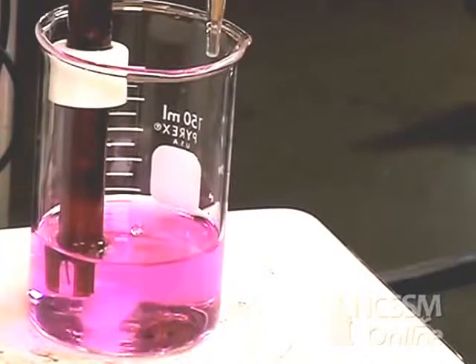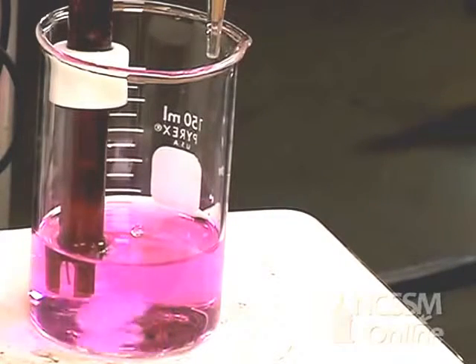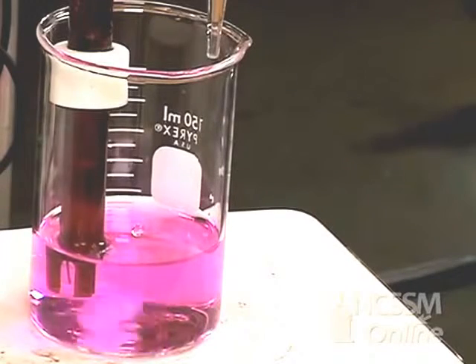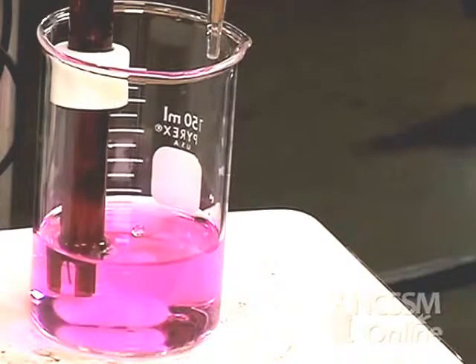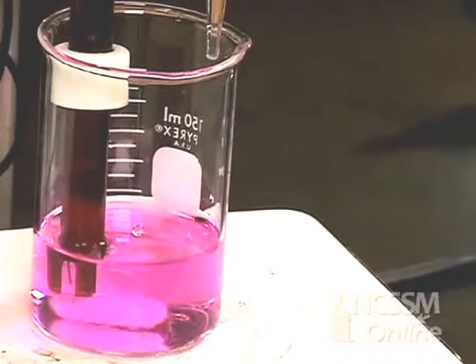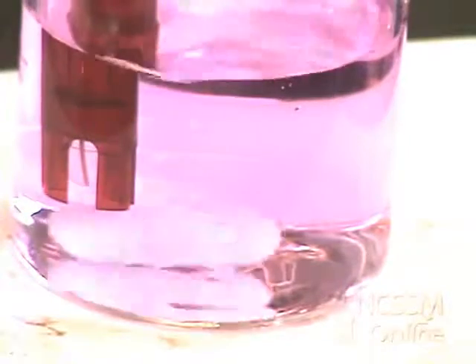You're going to add the HCl solution in 1 milliliter increments. Remember that you also want to include the volume that corresponds to the half equivalence point, the first equivalence point, the second half equivalence point, and the second equivalence point. You also want to record the volume when the indicator changes. The first indicator change will be from pink to colorless.